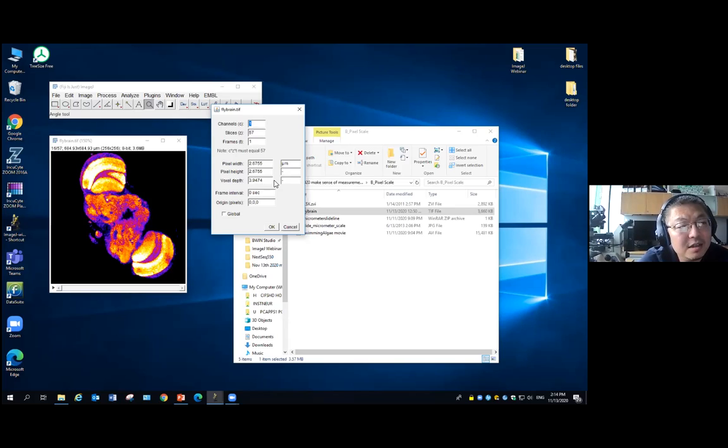And that information stays with the raw data. And once you open it in ImageJ, as I mentioned, I also ask you to save it. Once you do anything, you save it as TIFF. Once you save as TIFF, it stores this information in the TIFF. So later on, when you open the TIFF file, it will keep this information here. So that's also one thing very good about the TIFF. So whenever you do image analysis, I always suggest you save it as TIFF.